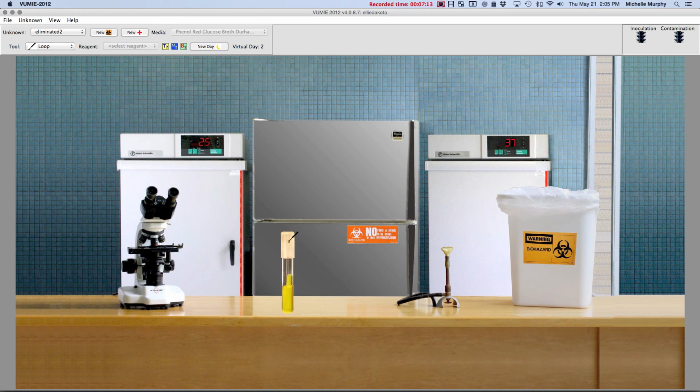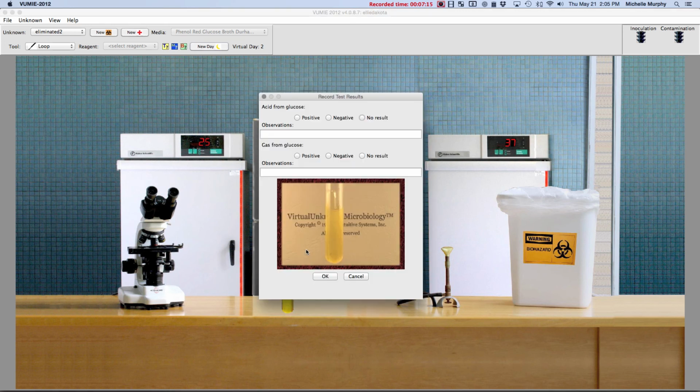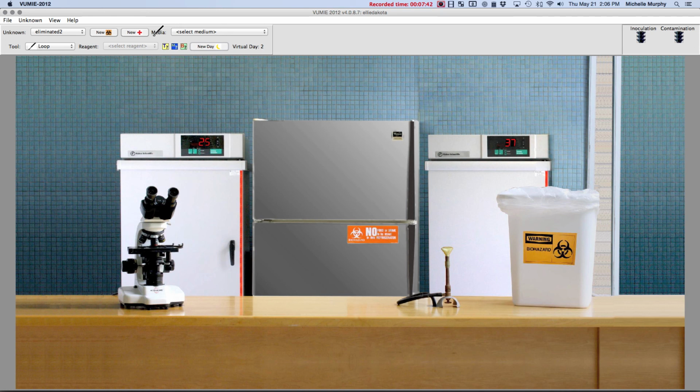Now I can record my results. You can see in there that on this one it looked like the gas tube was empty. It's kind of hard to see the gas tube, and that's where people make the biggest mistakes, is the gas tube here. We can't tell if it's positive or negative. We'll say it's negative. We'll say there's no gas in there, and then we'll see if there was an error, because it'll tell us. It is definitely a positive result for the acid because it's yellow. So sometimes it takes a little bit of finagling to get used to what the report is showing you.